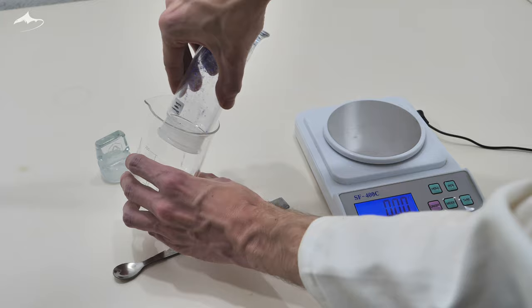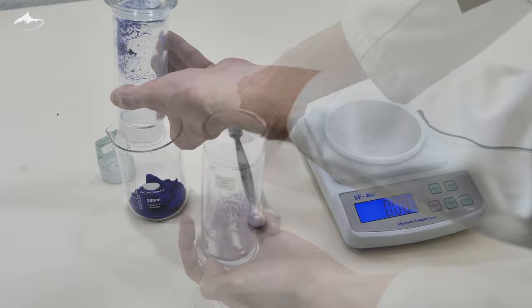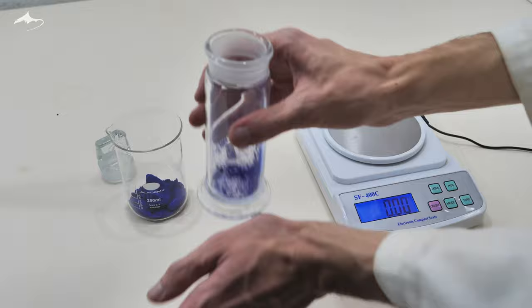While the temperature built up, the powder was transferred into a 250 ml beaker in order to weigh it. Doing this gave me an idea how much weight was lost during storage. As you can see it formed a lump but all it needed was a little bit of work with the metal spatula to break it up.